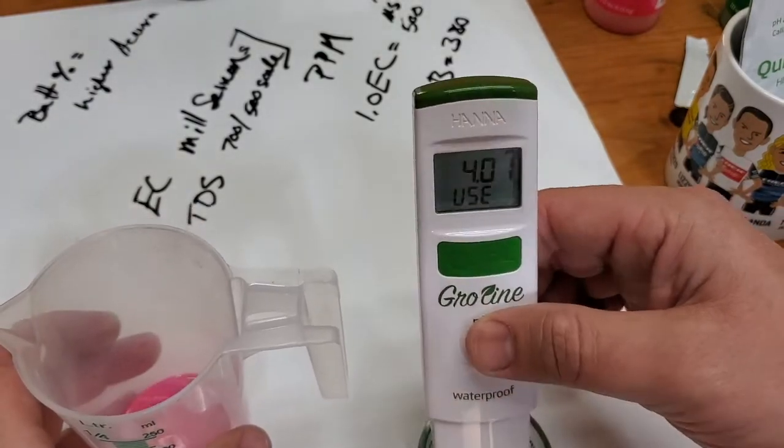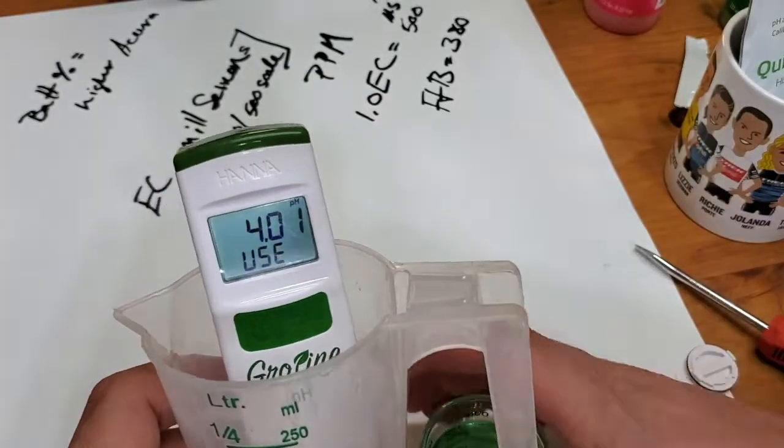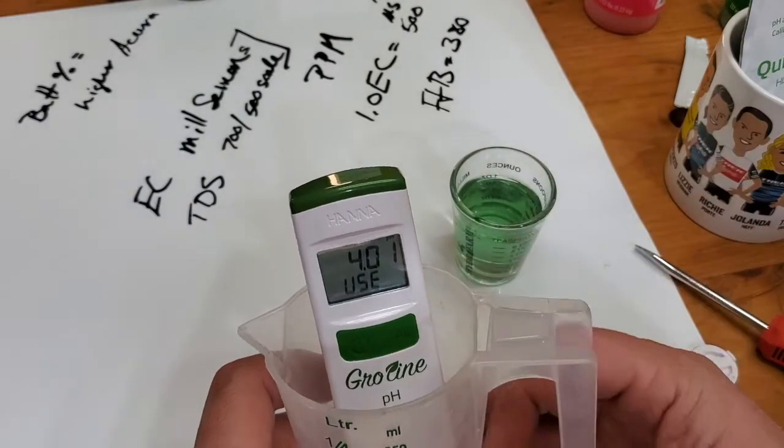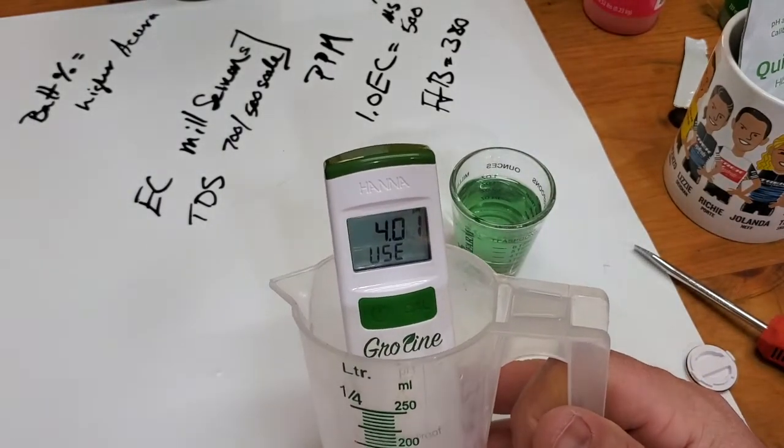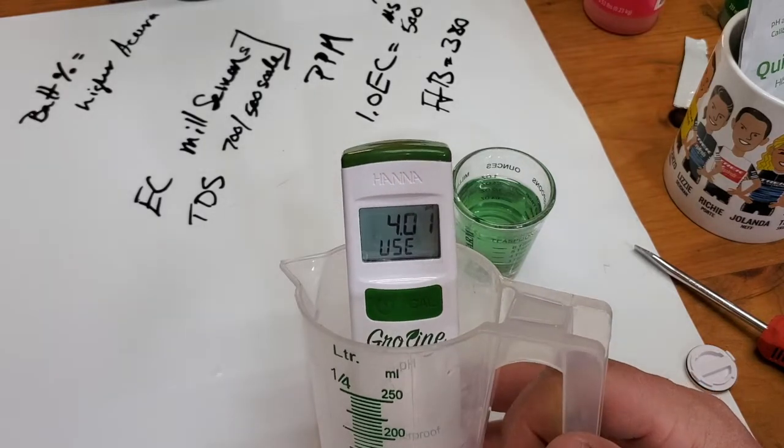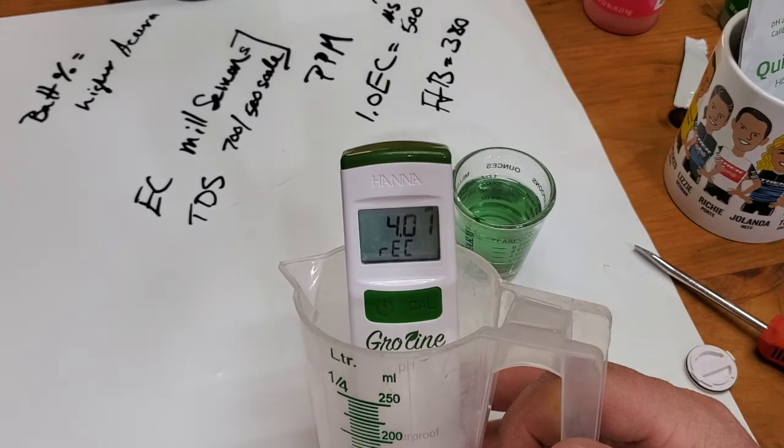Now it's telling me to use the four. Before here, I should have rinsed the probe off in between, but let's take a demonstration, do it quickly. So it's recording that.